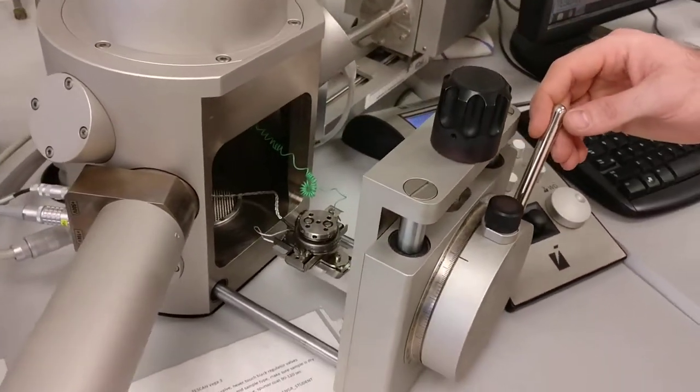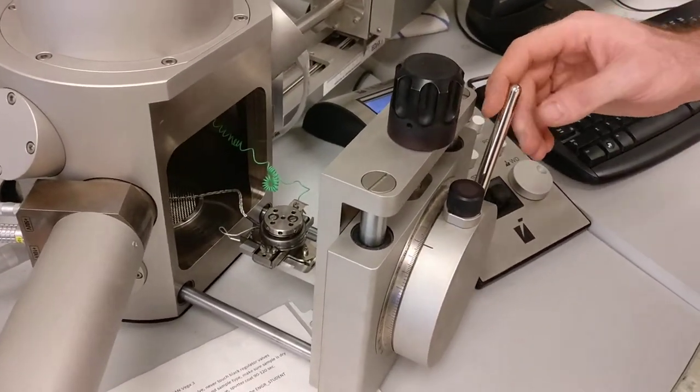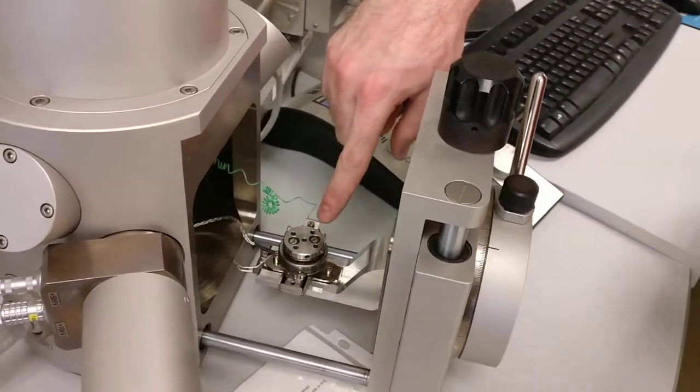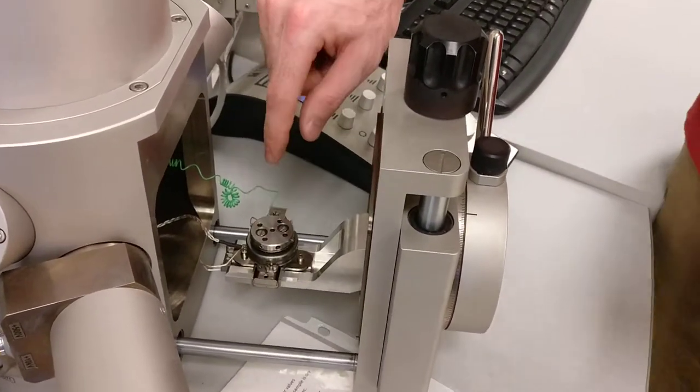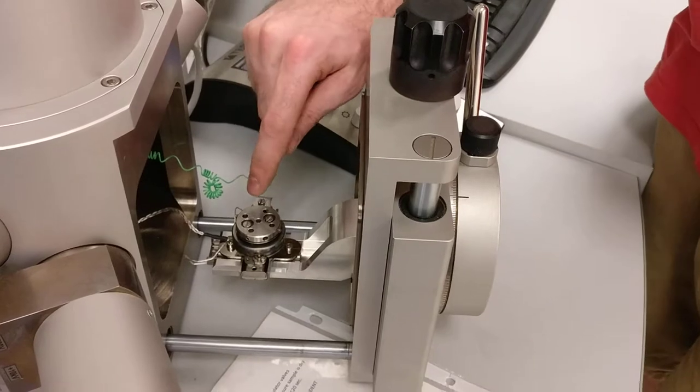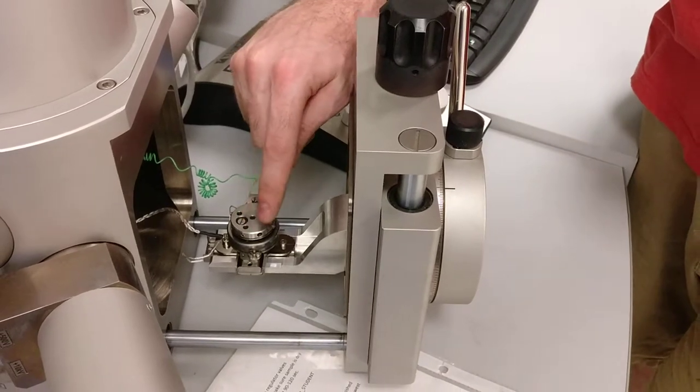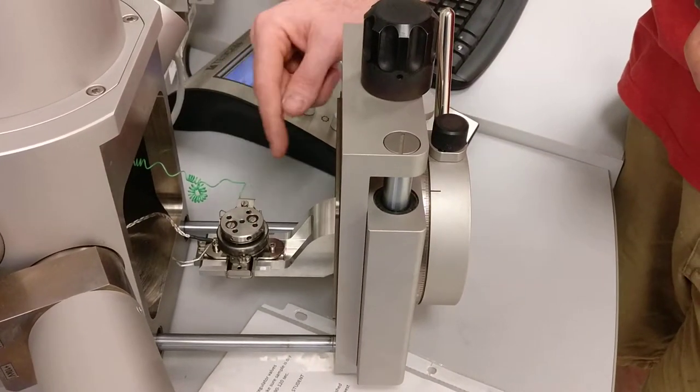We're going to look inside at the stage. It's got five holes in it, so we could put four small stubs in those corners, each of them having a little set screw in the side.